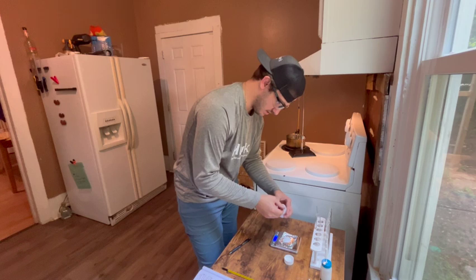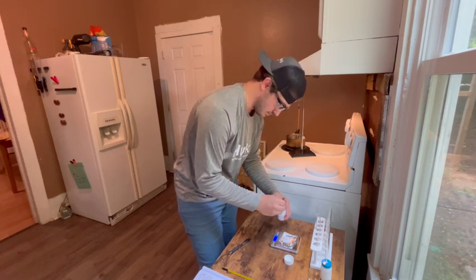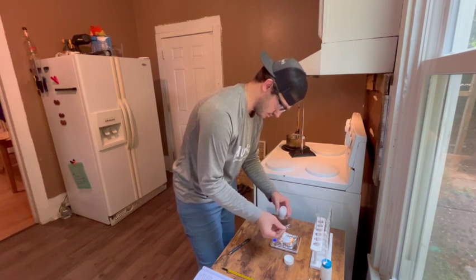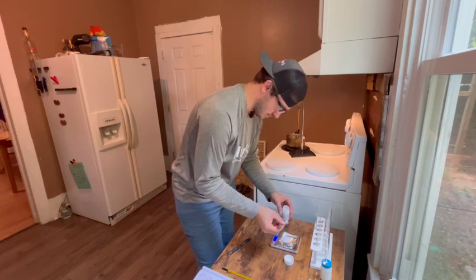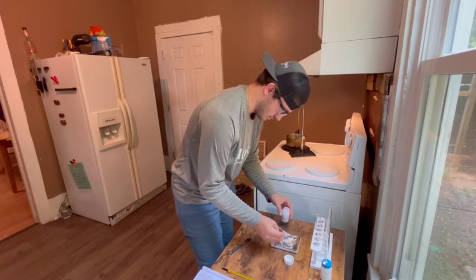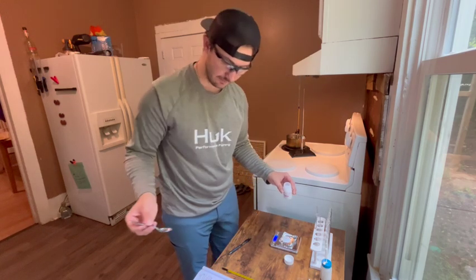Right now we're at 1.3. I need 1.5. 1.55, we're gonna go with that.